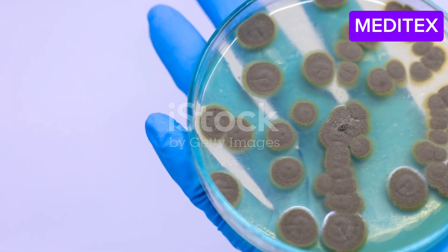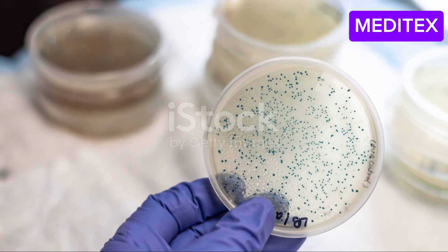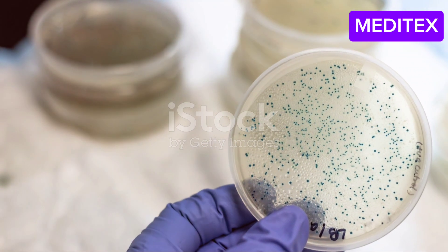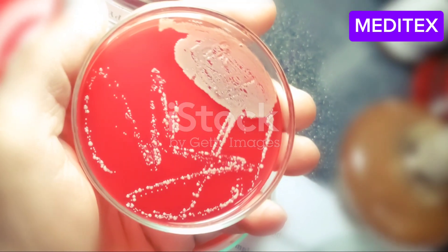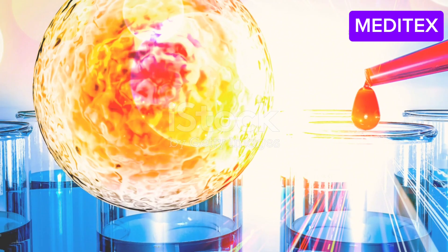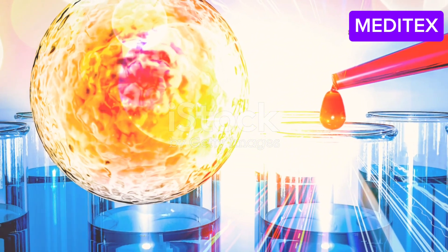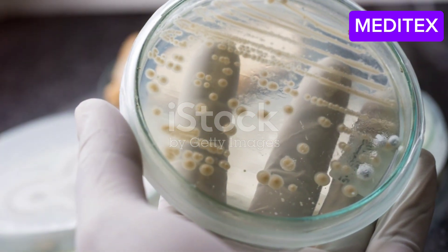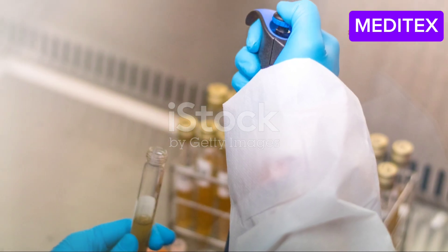After incubation, it's time to read the results. Most commonly, this test uses a gel clot method. Check for clot formation by gently inverting the tube. If a firm clot remains, it indicates the presence of endotoxins. Compare your samples with the standards to determine the endotoxin levels.